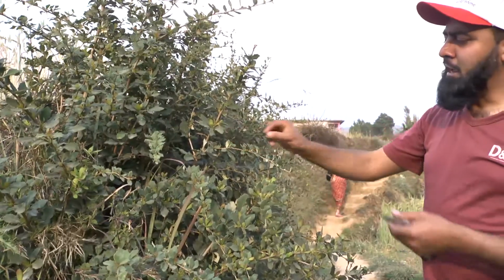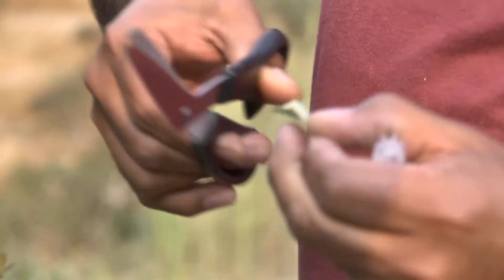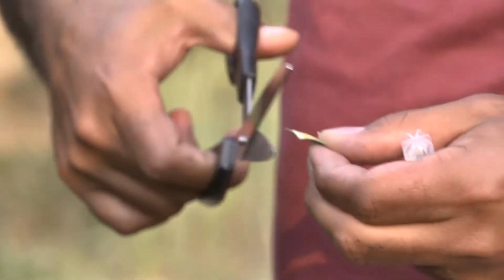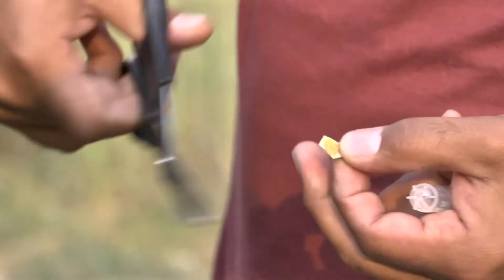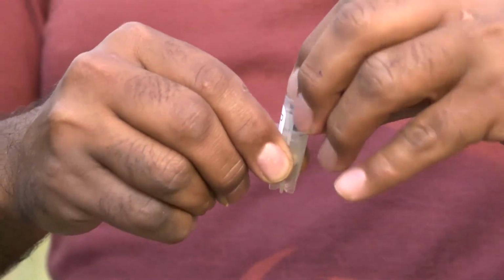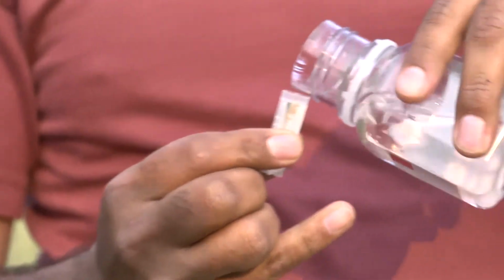For DNA samples, you detach the leaf with aecia, and then you just cut the leaf around the aecia, and you just leave this aecial cluster which contains several aeciospores. So now you have the lesion, and you can use cryotubes, but if you don't have these cryotubes, you can use simple 2 ml Eppendorf tubes. So you put this lesion into this cryotube or Eppendorf tube and then put some alcohol to this sample.